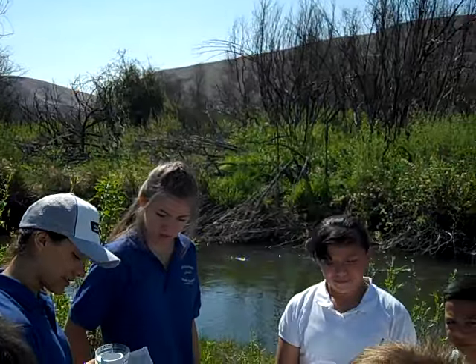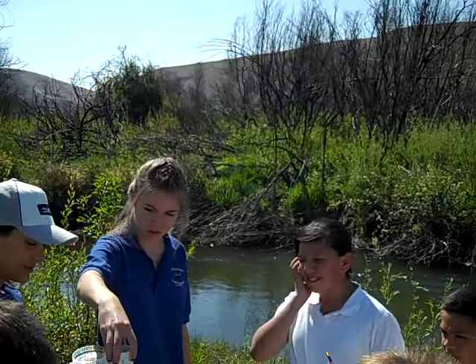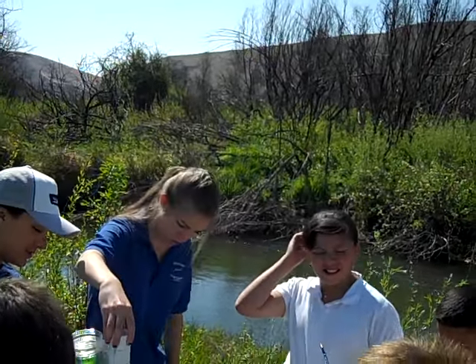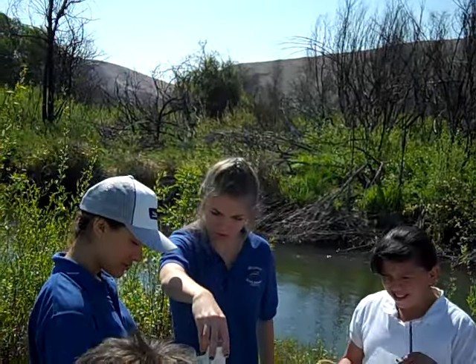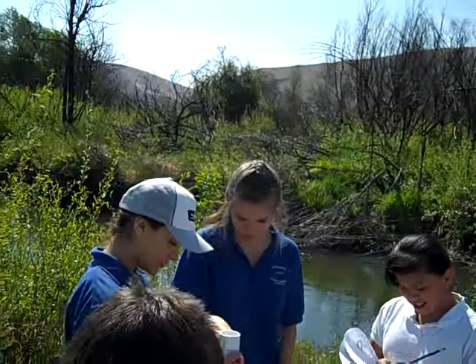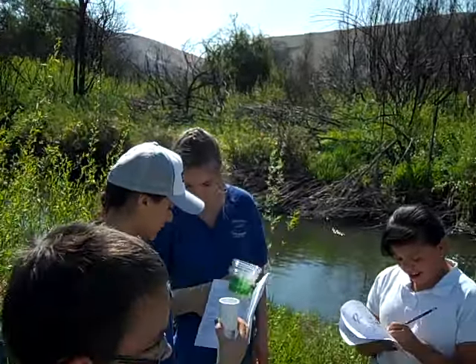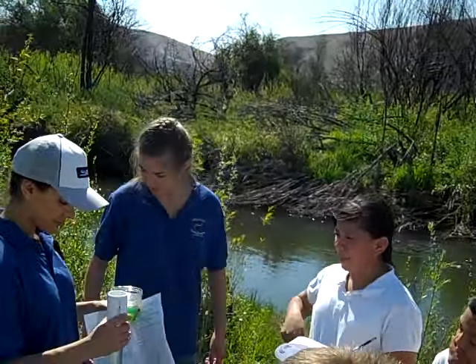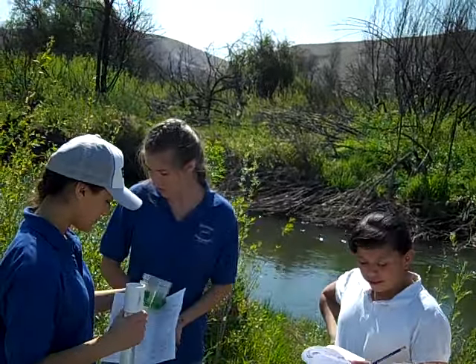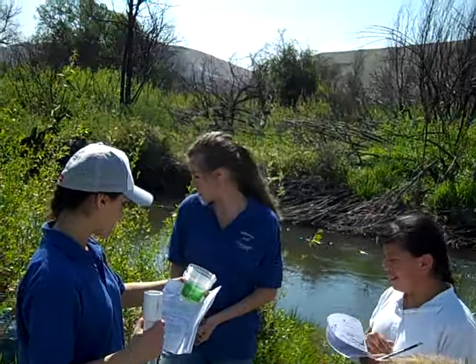For the tap water, we had all the way to the top. Okay, so we don't have to put the tap water, but that was just kind of comparison. So now we're going to move on to, you want to do dissolved oxygen? Okay.